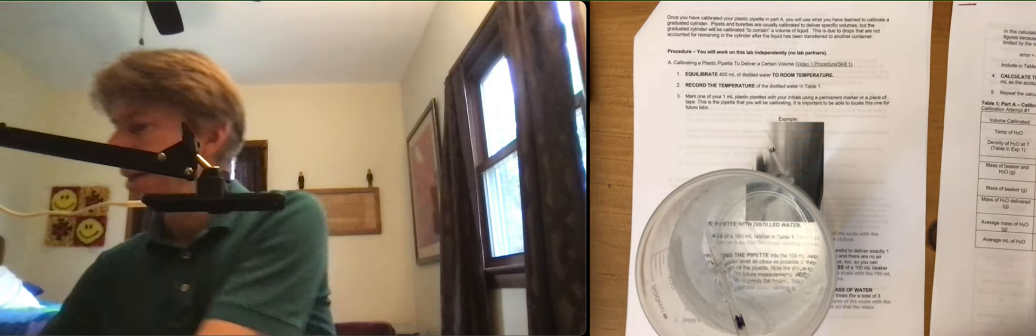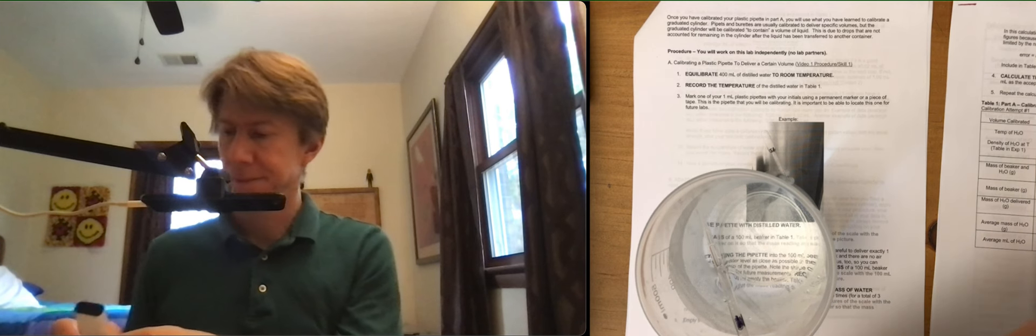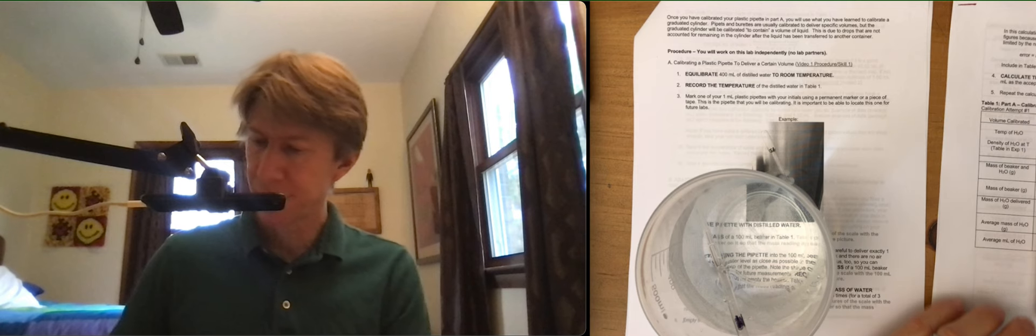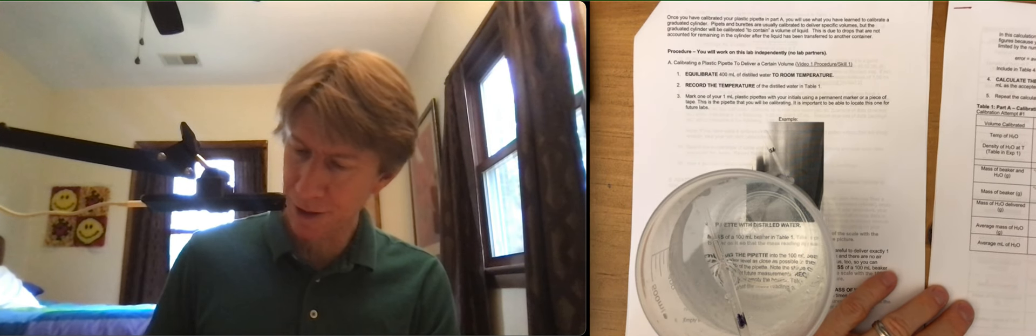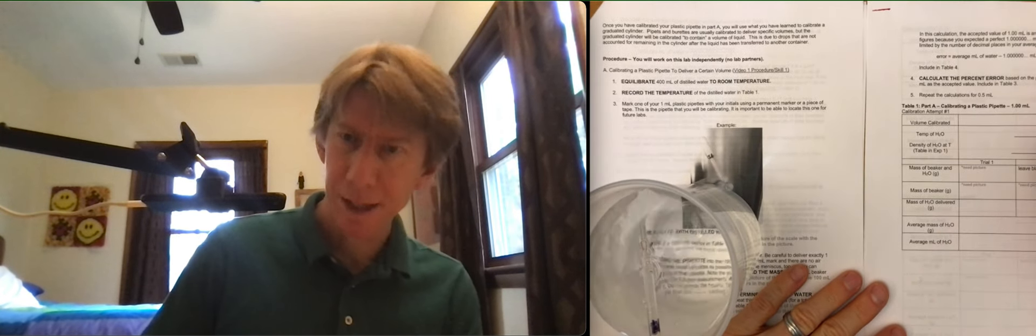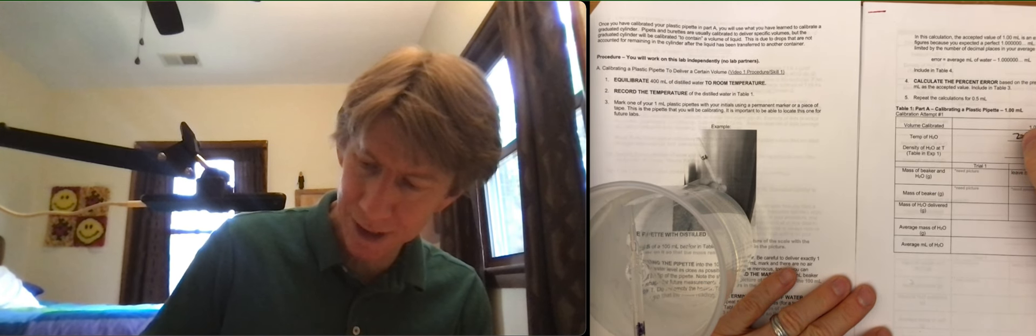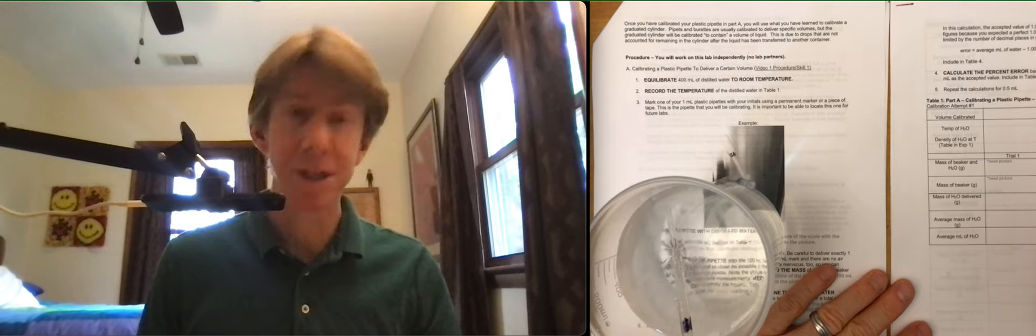My temperature is going down. It's staying steady now so I'm going to go for 20.0 degrees. That's what I got. Turning it off. Writing down 20.0 degrees here on the table. Always writing down temperature to the tenths place because that's what it displays.